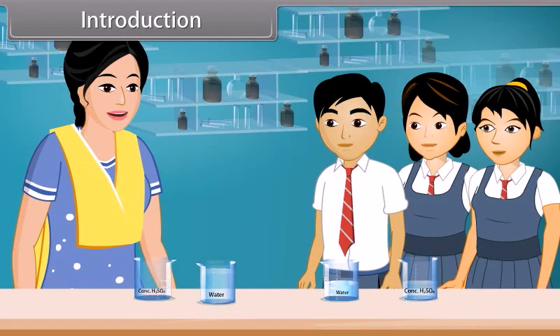This shows that concentrated sulfuric acid has a great affinity for water. Its dissolution in water is highly exothermic in nature. Therefore, for dilution of the acid, always add acid to water slowly and not water to acid.